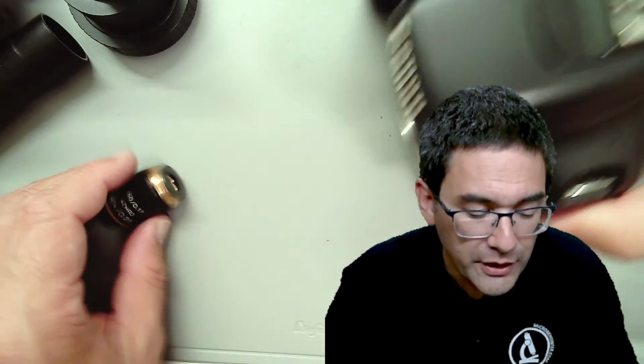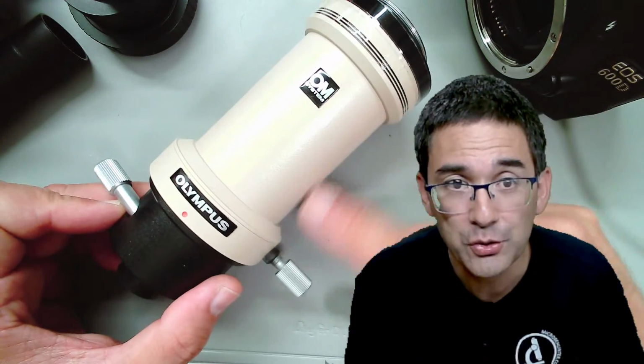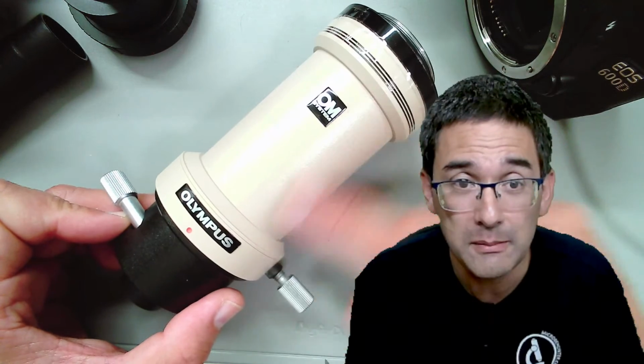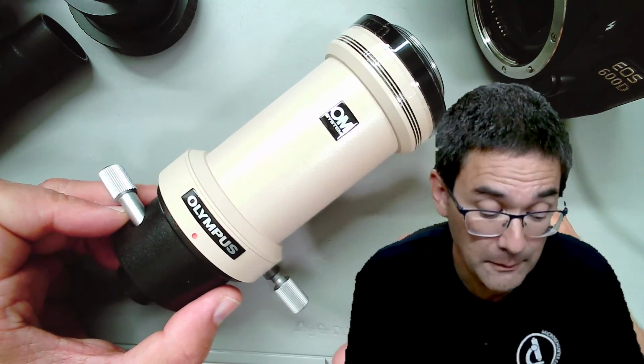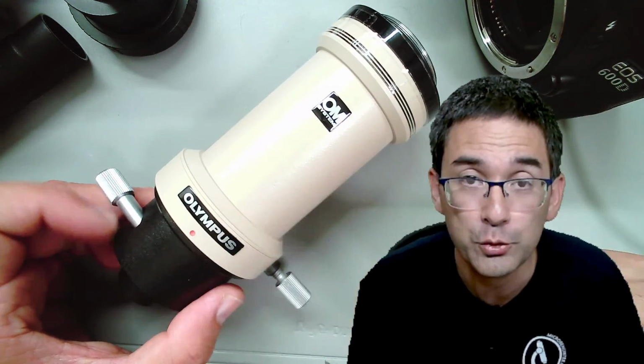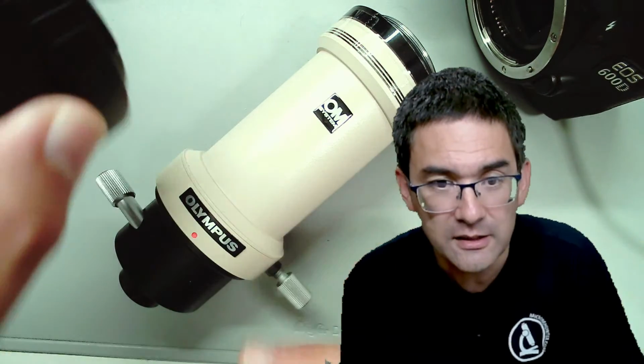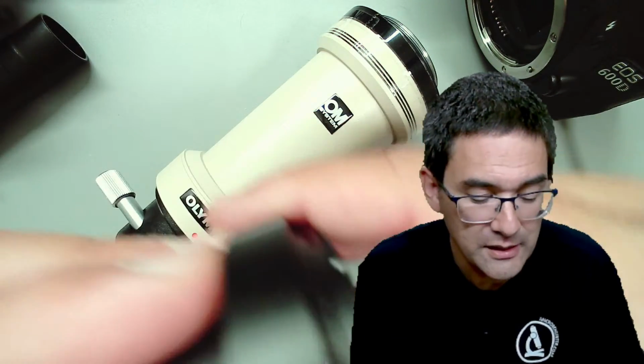I would like to show you a traditional system that is not manufactured anymore, but which I've used for a very long time. This is the Olympus Adapter system. It's not made anymore, maybe they sell it secondhand. But this one has an interesting optical photo projection eyepiece that I want to talk about, simply to show you that this whole issue with chromatic aberration is indeed an issue.